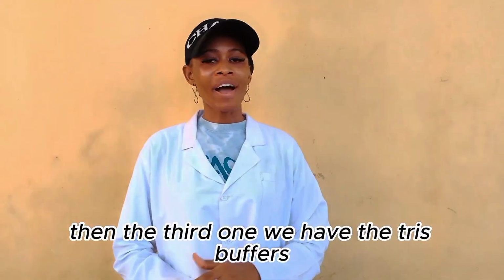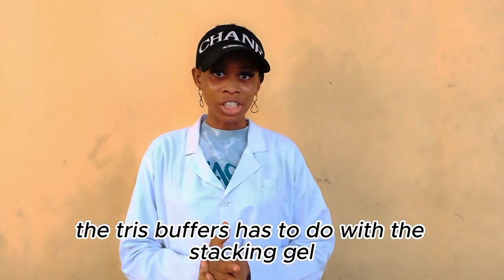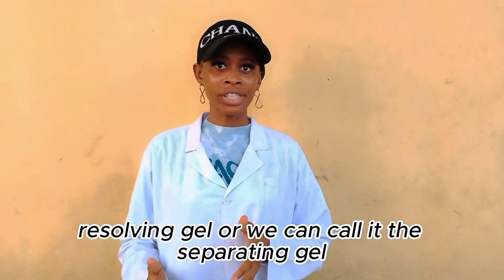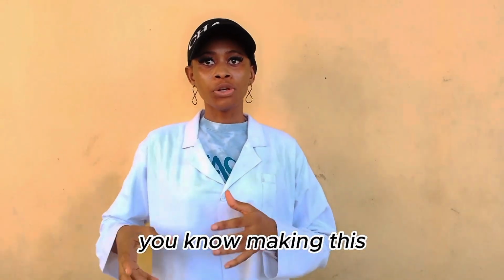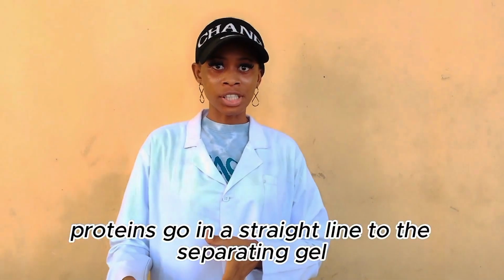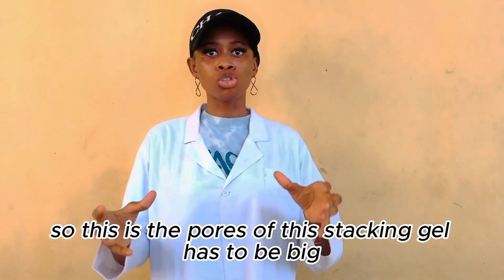Then the third one, we have the Tris buffers. The Tris buffers has to do with the stacking gel, the resolving gel, or we can call it the separating gel, and the running buffer. The stacking gel is used in making these proteins go in a straight line to the separating gel. So the pores of this stacking gel have to be big.